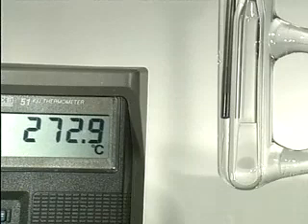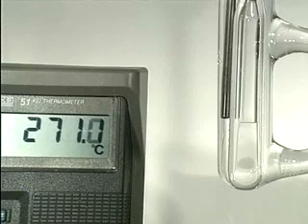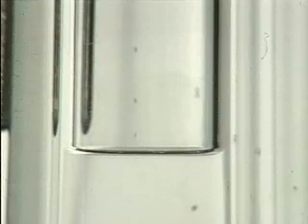Note that the thermometer is present only to indicate increasing and decreasing temperature and an approximate range for the critical temperature.